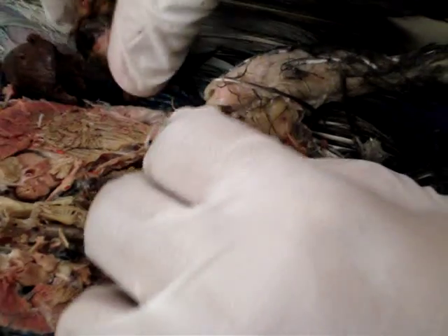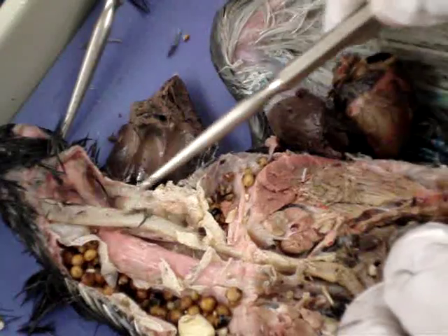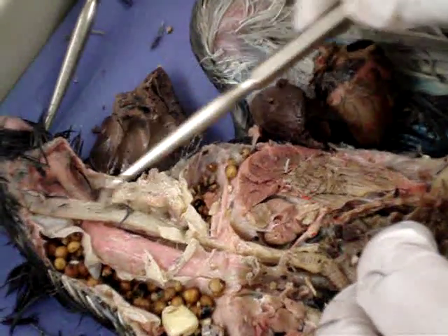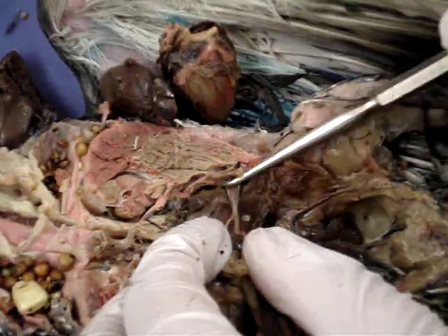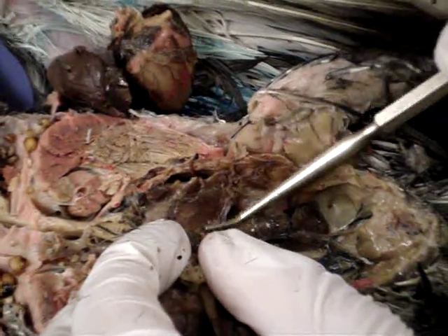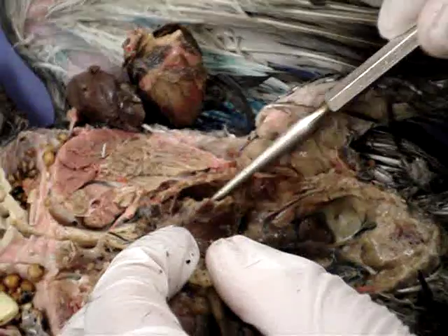The lungs can be found by following the trachea as it splits left and right to the lung. Here is one lung, right here. The other is on the other side. This whole section that's moving is the lung.